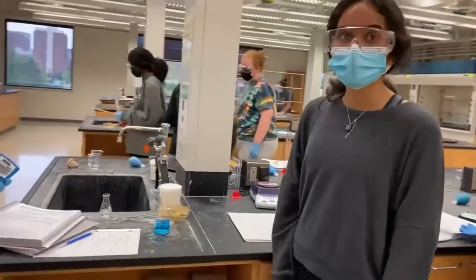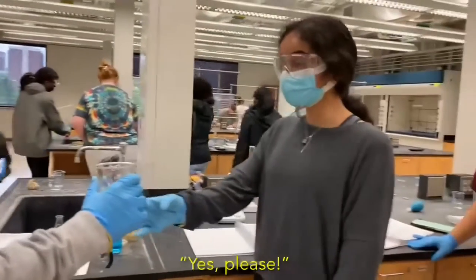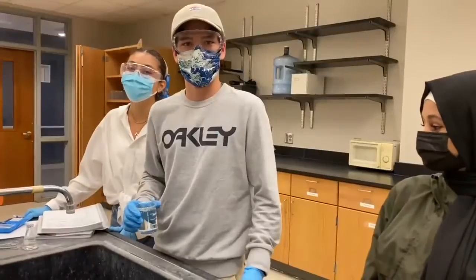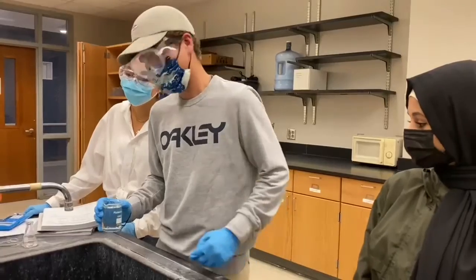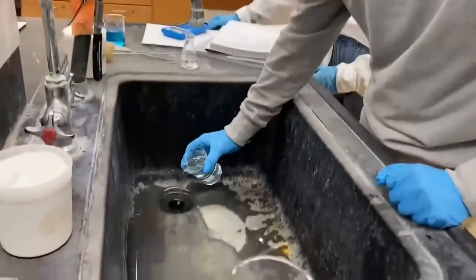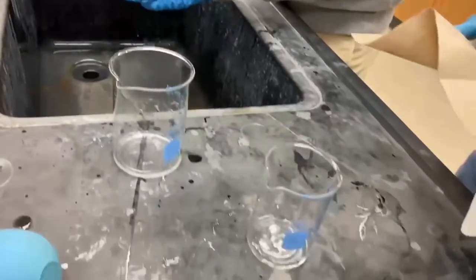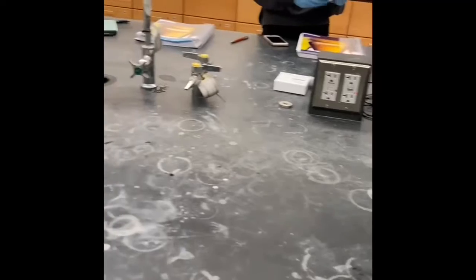If you have extra solution, offer it to a neighbor. Do you guys need more solution? Yes, please. But in the case that your neighbor does not say yes to your offer of the extra solution, you need to dispose of it instead of pouring it back into its original container. Wash and clean all leftover materials and glassware. Once you're done, clean up your workspace.